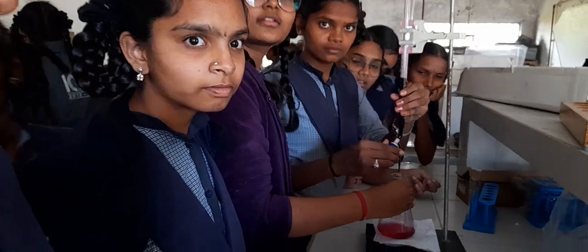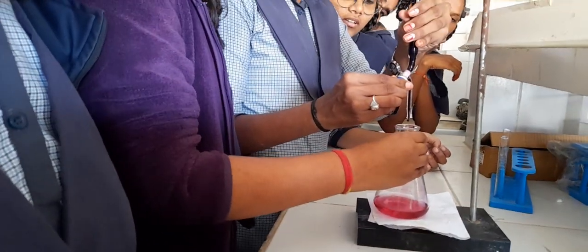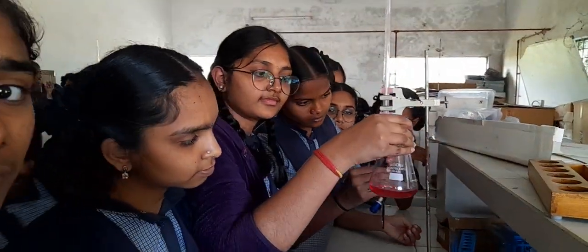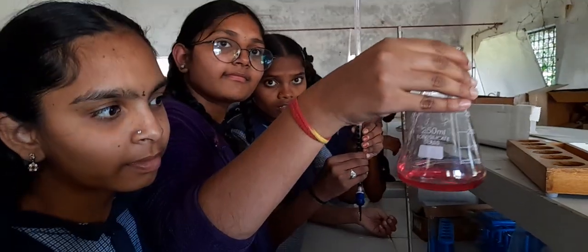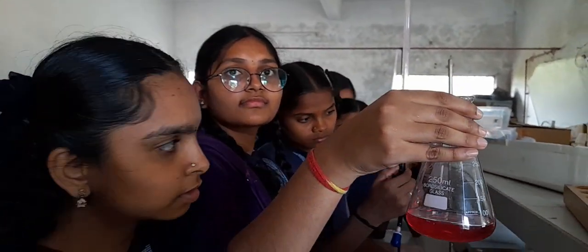Yes, children. You got your pink color. Yes, ma'am. So that is your end point. Can you show it to me? Okay, this is your pink. Right. Good. What is your value?